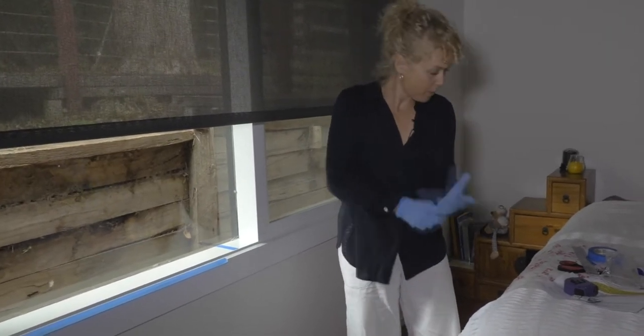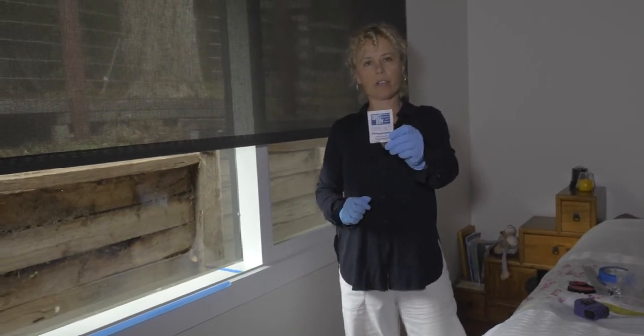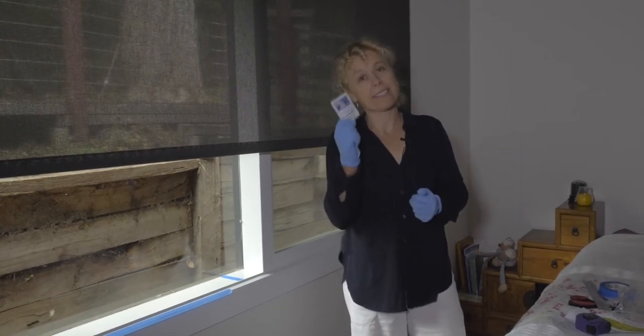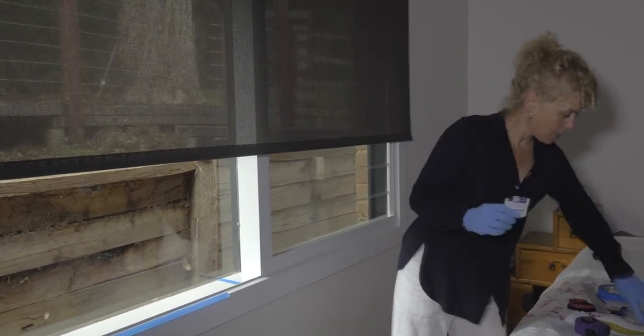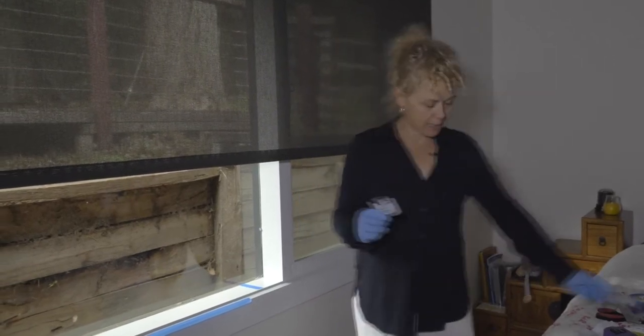To do dust wipes, you'll be provided with what's called a ghost wipe, and this follows the ASTM E1792 standard. So it's important that you can't just use an alcohol swab, it needs to come from the lab. You're going to open this up like this, and make sure, of course, you've got this close by because you're going to be putting the wipe into the container.